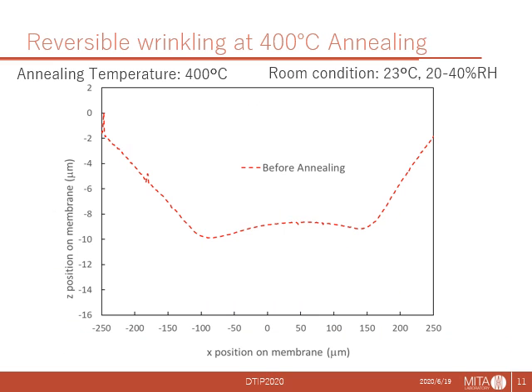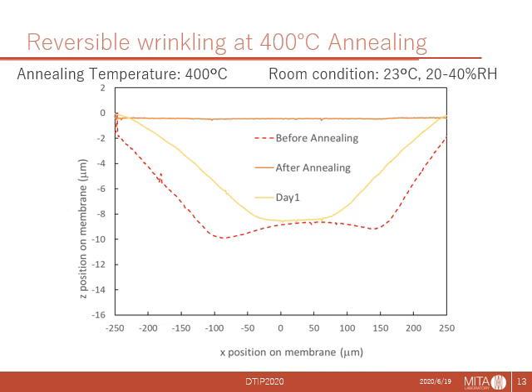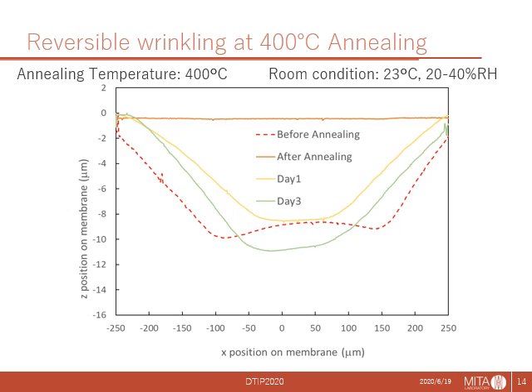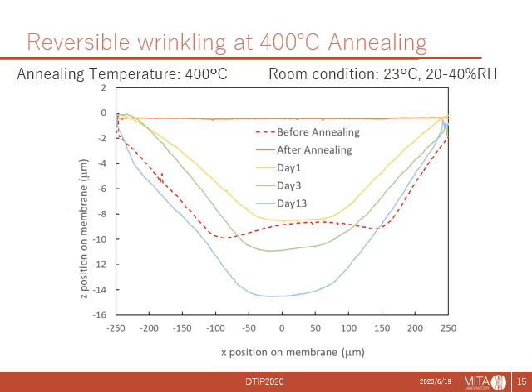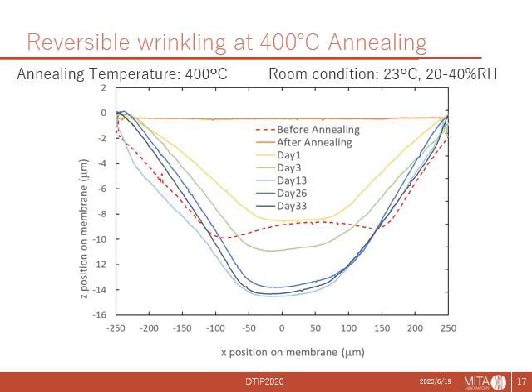This graph indicates the profile of the membrane wrinkling before annealing. It became flat after annealing. However, deflection had appeared the next day, and it got larger and larger, day by day. The deflection was even larger in 2 weeks than that before annealing.